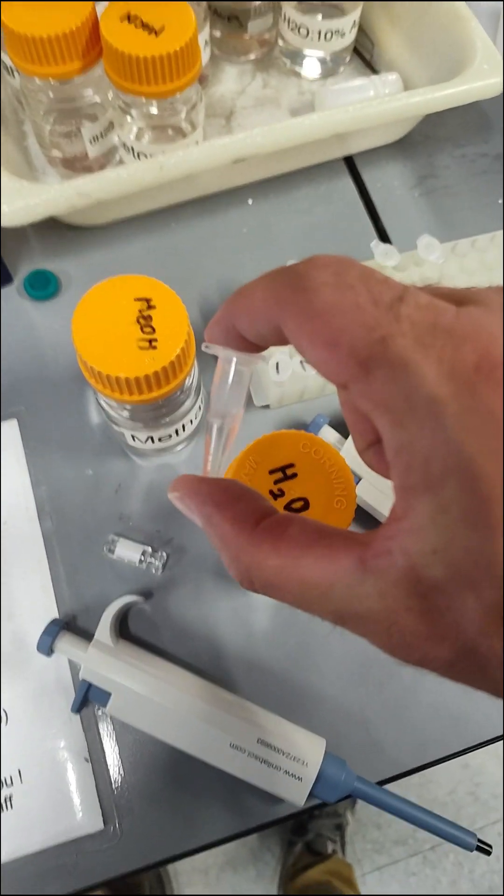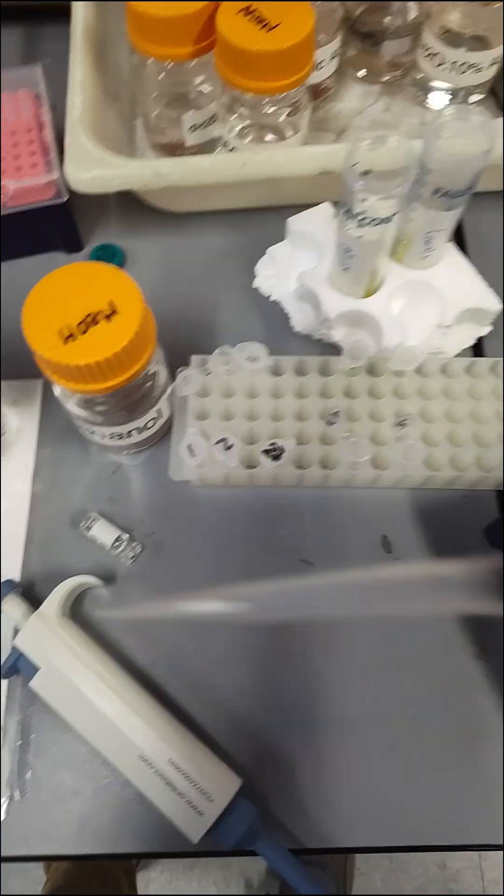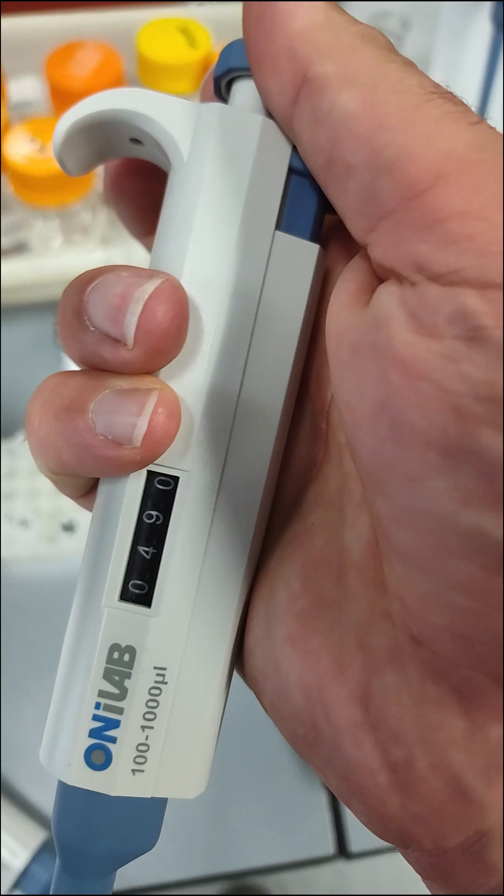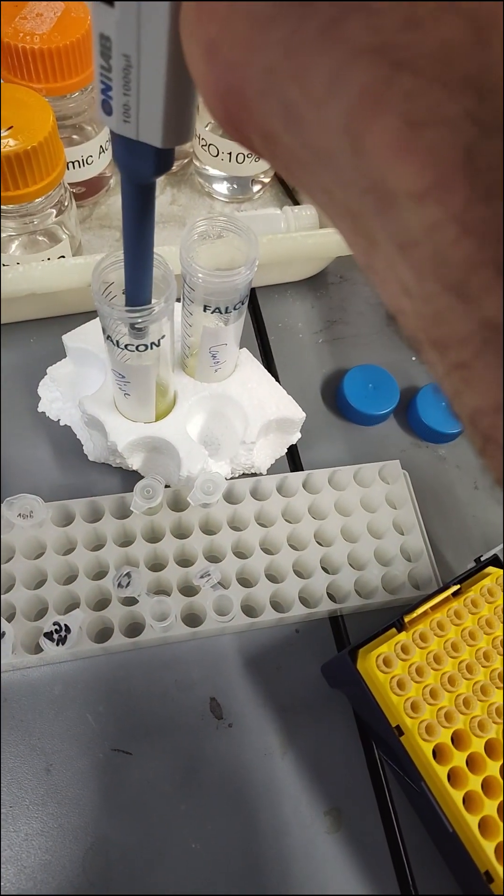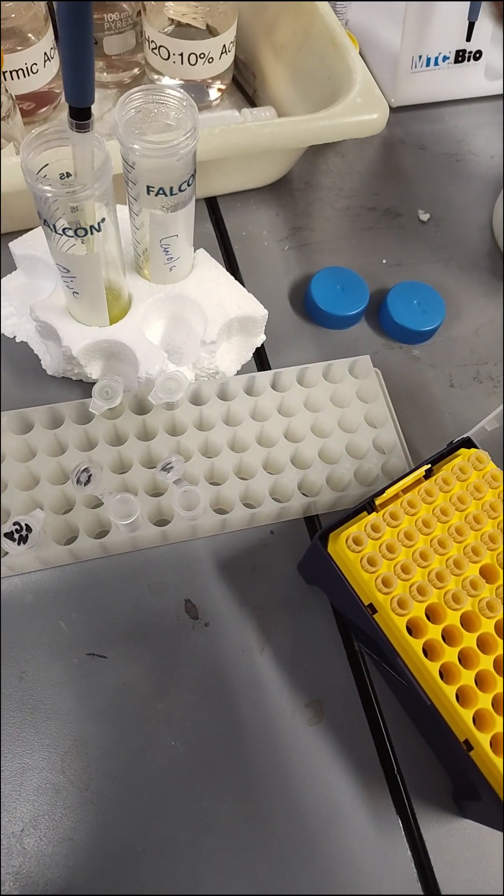I just made up one mL of 80-20 methanol water. So here we go. So we're bringing this down to 500. There we go, 500 of olive oil. Pipette up slowly with oil. You see, you always get some air bubbles.